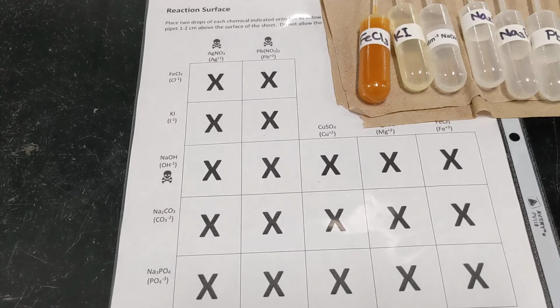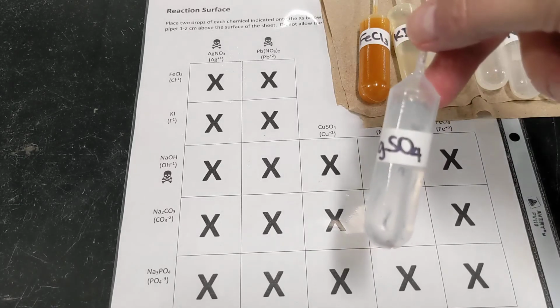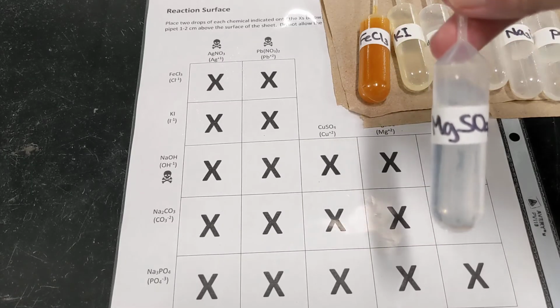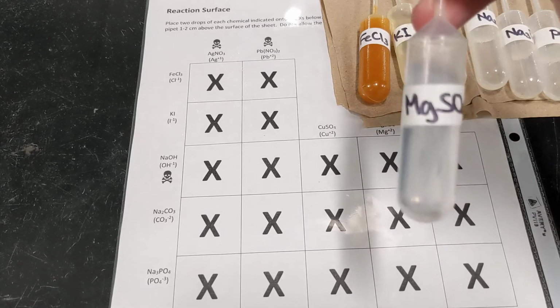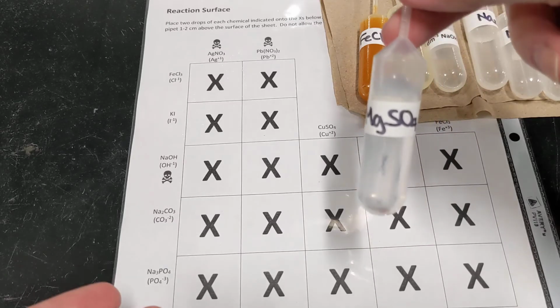All right, we are going to collect data for our ionic compound dropper lab today. And so I've collected a variety of ionic compounds, and what I've done is I have dissolved them in water. So they're a little easier to work with and they react a little more easily when dissolved in water. So we know all ionic compounds are solids at room temperature, and some of them do dissolve in water, and so these are all compounds that form aqueous solutions.